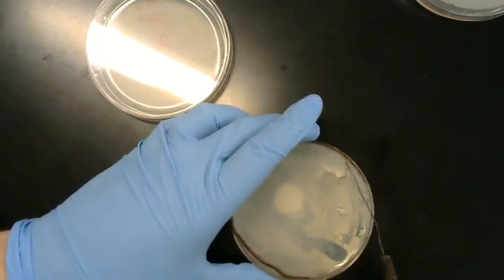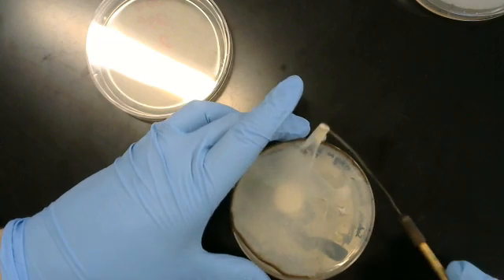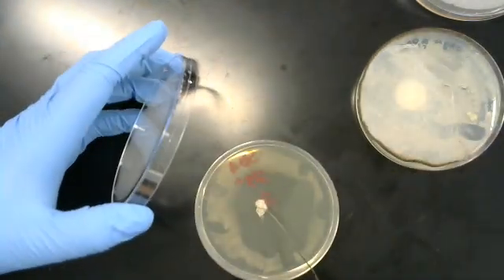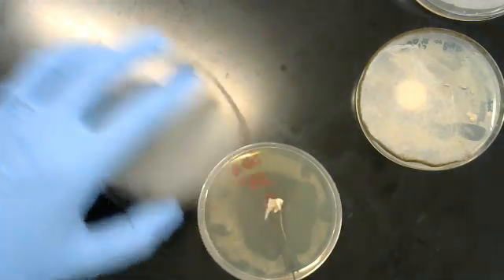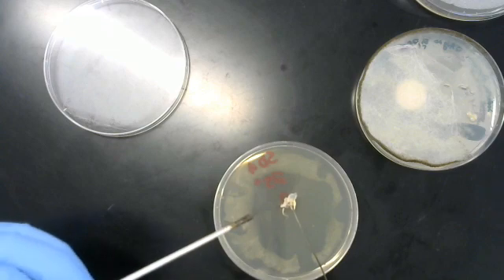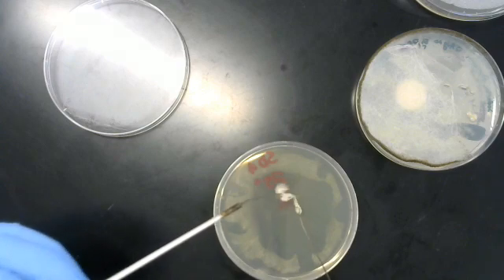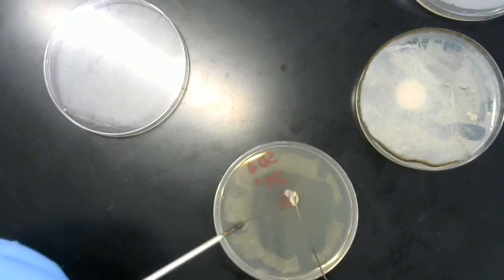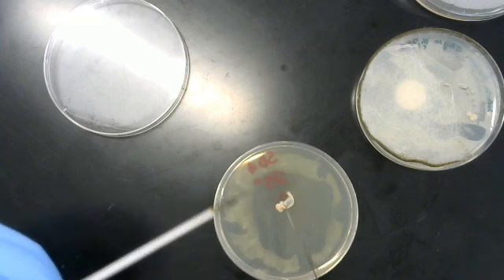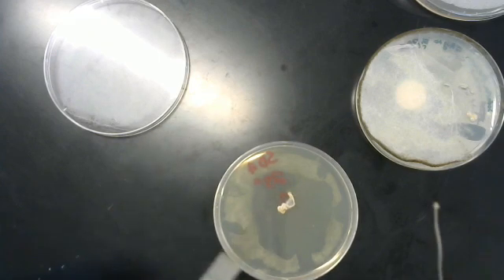Oh, there's the issue. Right like that. And place it in the center, and we'll see what the growth is going to be.